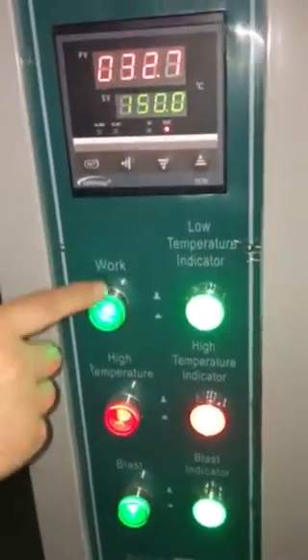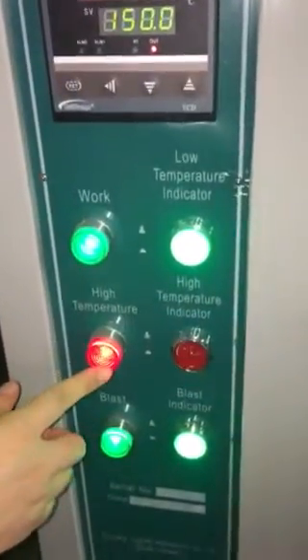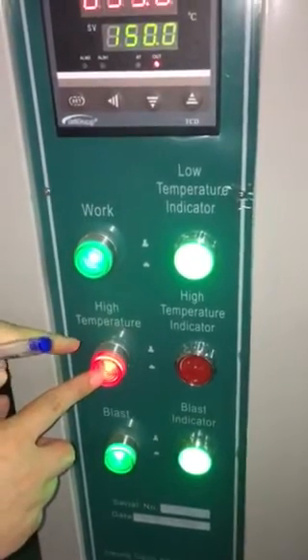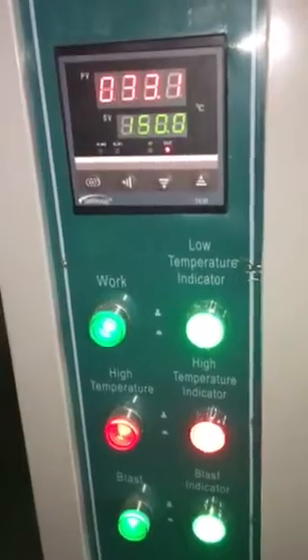If you need to raise the temperature quickly, press this. This is off. You need the temperature quickly — press this to add the temperature. Now it's okay.